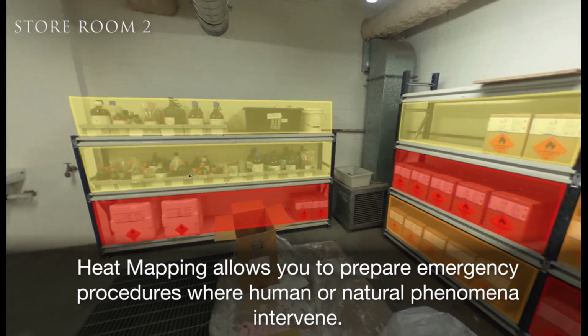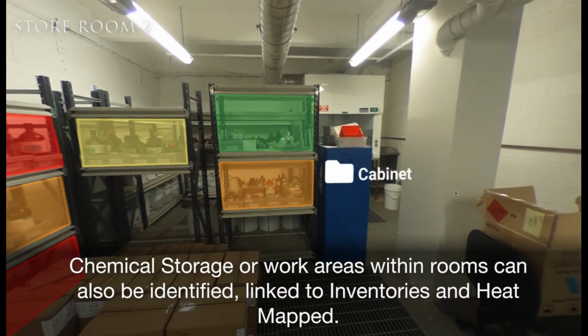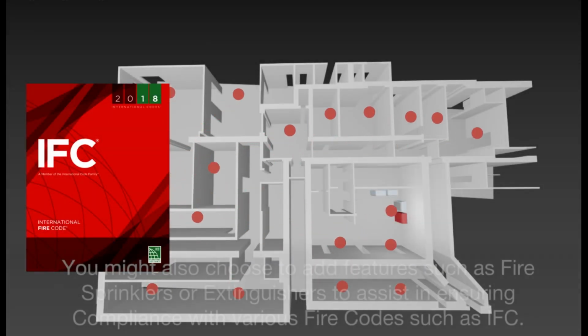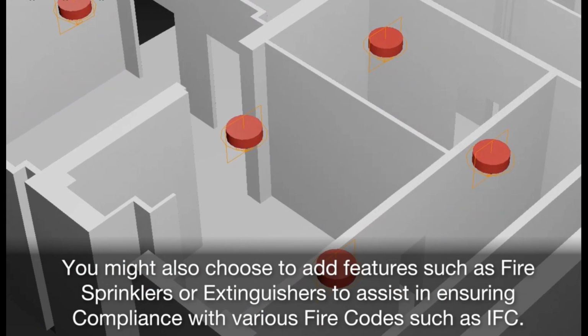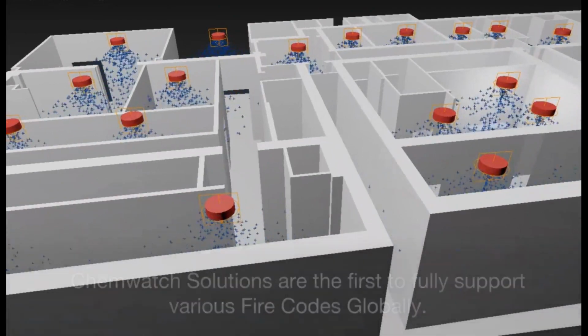Heat mapping allows you to prepare emergency procedures where human or natural phenomena intervene. Chemical storage or work areas within rooms can also be identified, linked to inventories, and heat mapped. You might also choose to add features such as fire sprinklers or extinguishers to assist in ensuring compliance with various fire codes such as IFC. Chemwatch solutions are the first to fully support various fire codes globally.